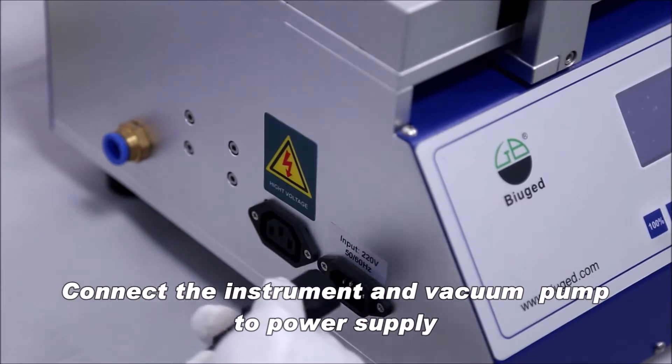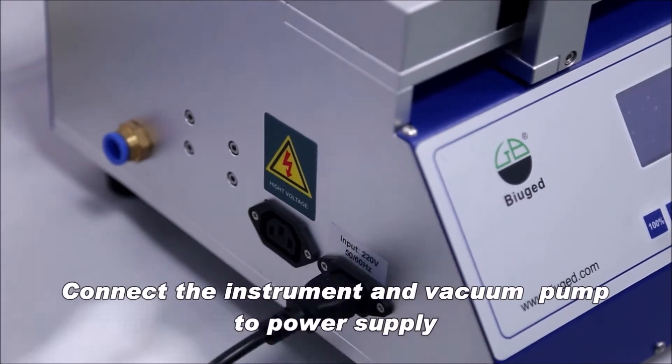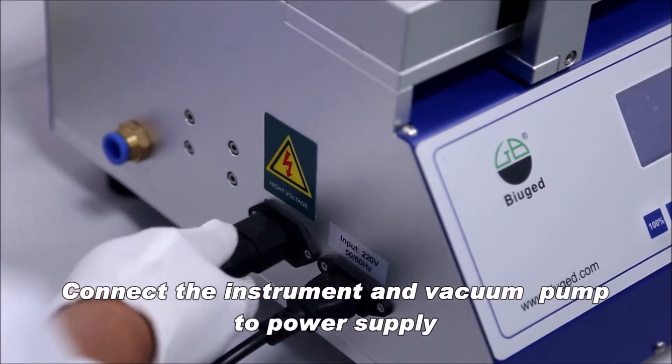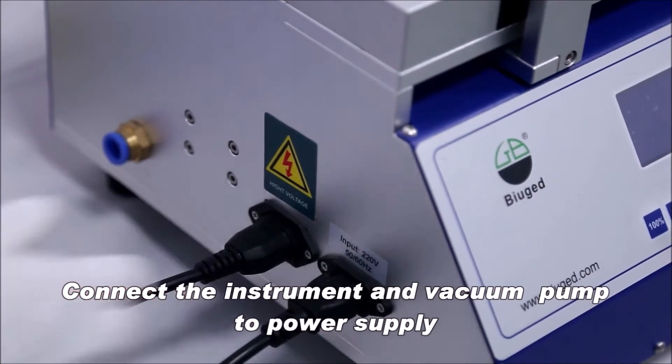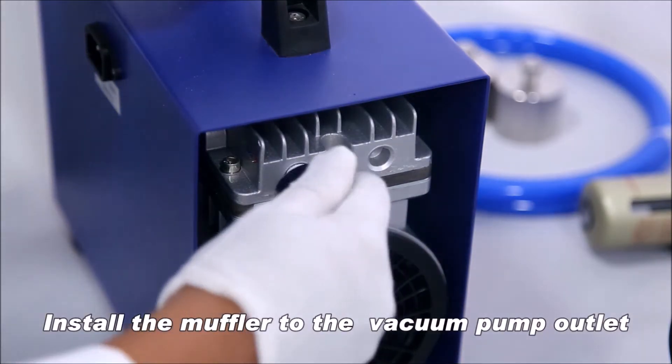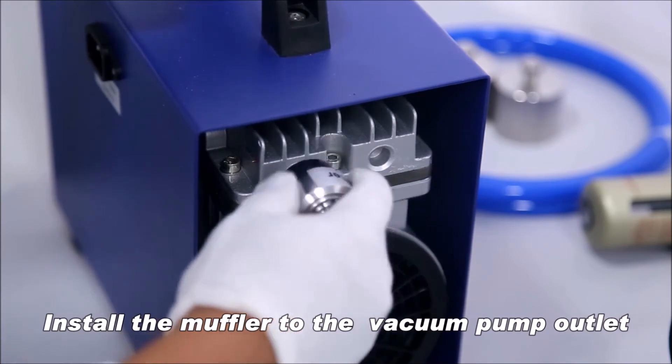Step 2: Connect the instrument and vacuum pump to power supply. Step 3: Install the muffler to the vacuum pump outlet.